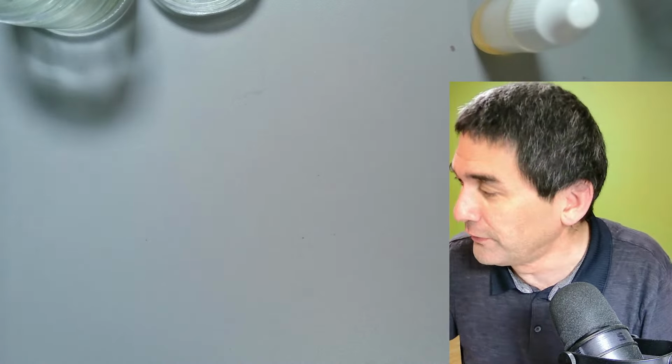If there is a little bit of oil on the other lenses, then you can use some alcohol to carefully clean it off, but it should not be actually dipped in oil so that there is too much oil, which can actually go into the cracks of the lens. Yeah. So desk view, here we go.